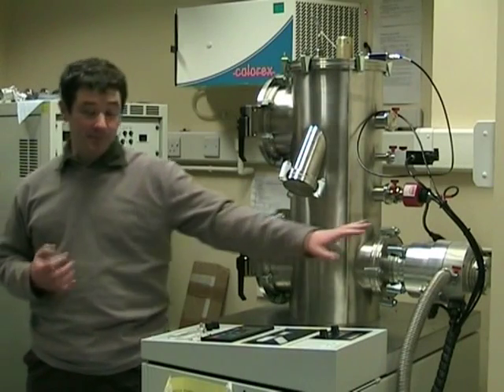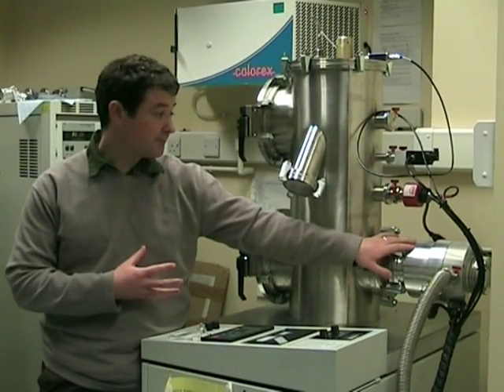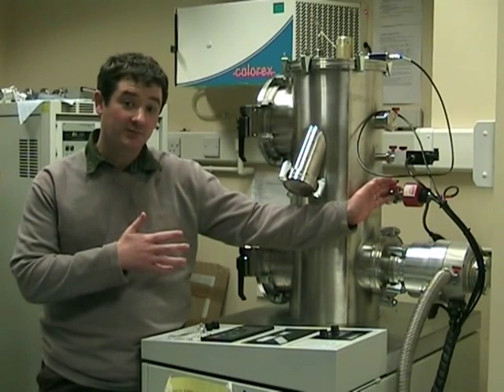At the back of the chamber, we have the turbo pump, and also the pressure gauge itself.